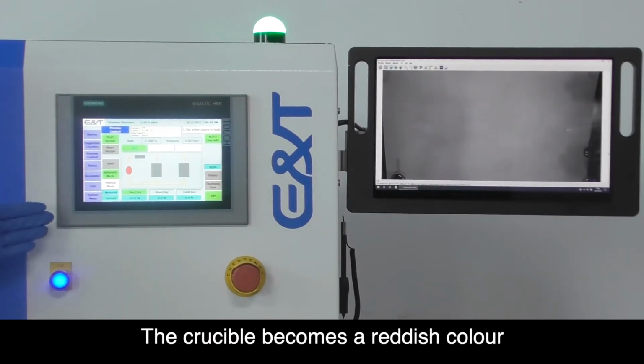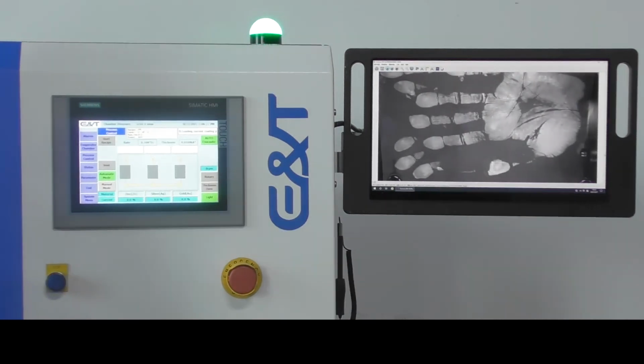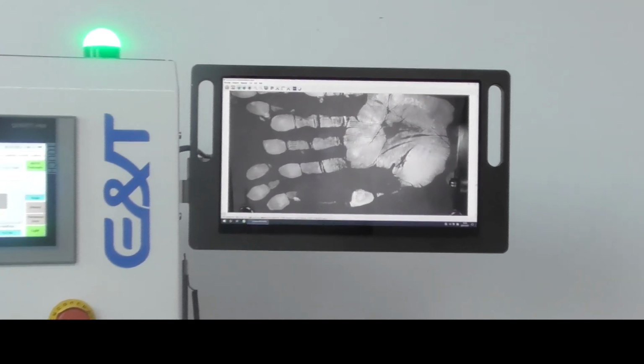The crucible becomes a reddish colour and the fingerprint becomes visible on the touch panel very soon. The entire process takes up to 4 minutes.